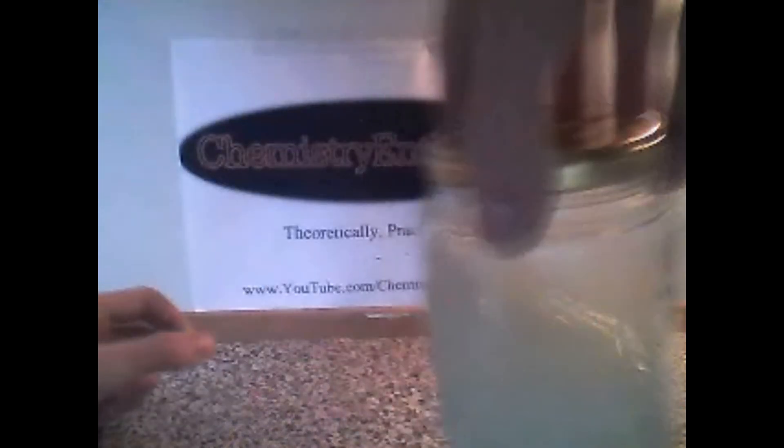And as you can see, it is both copper chloride and copper hydroxide. When you mix it with diluted hydrochloric acid, it is almost pure copper chloride. I meant hydrochloric acid, thank you.